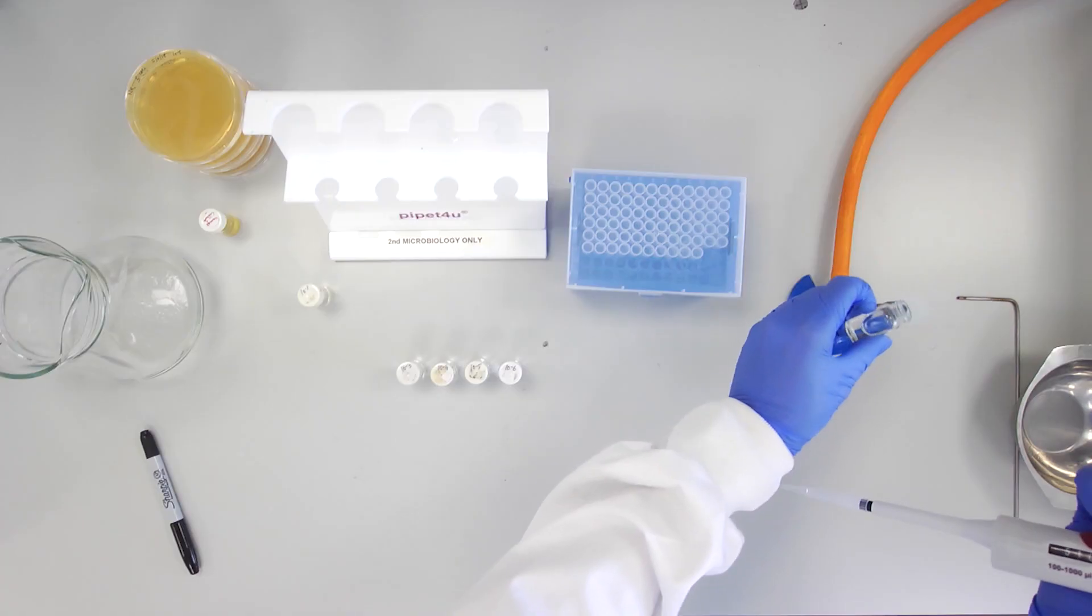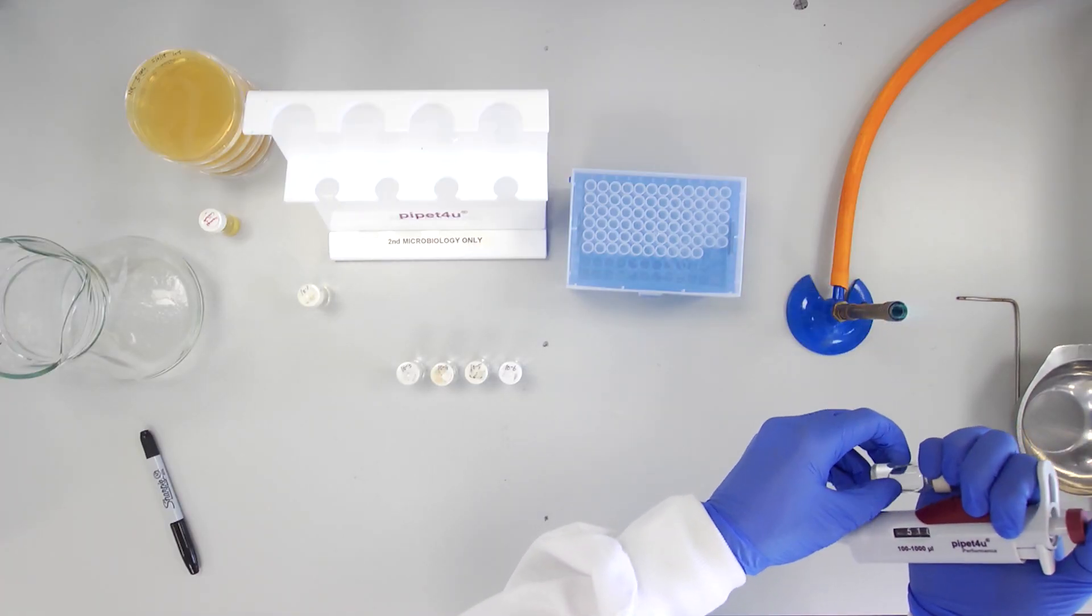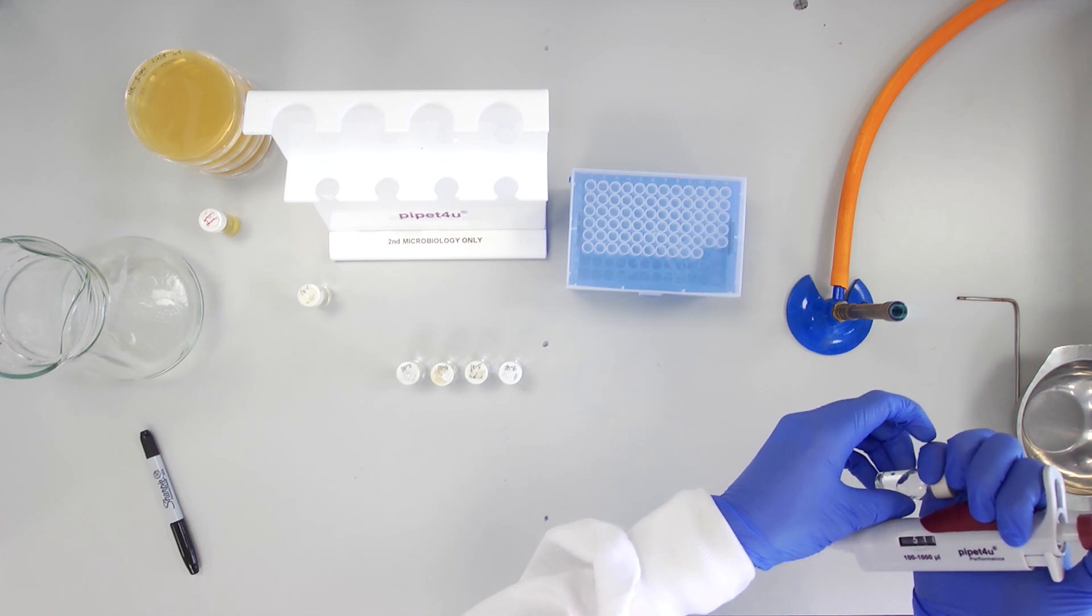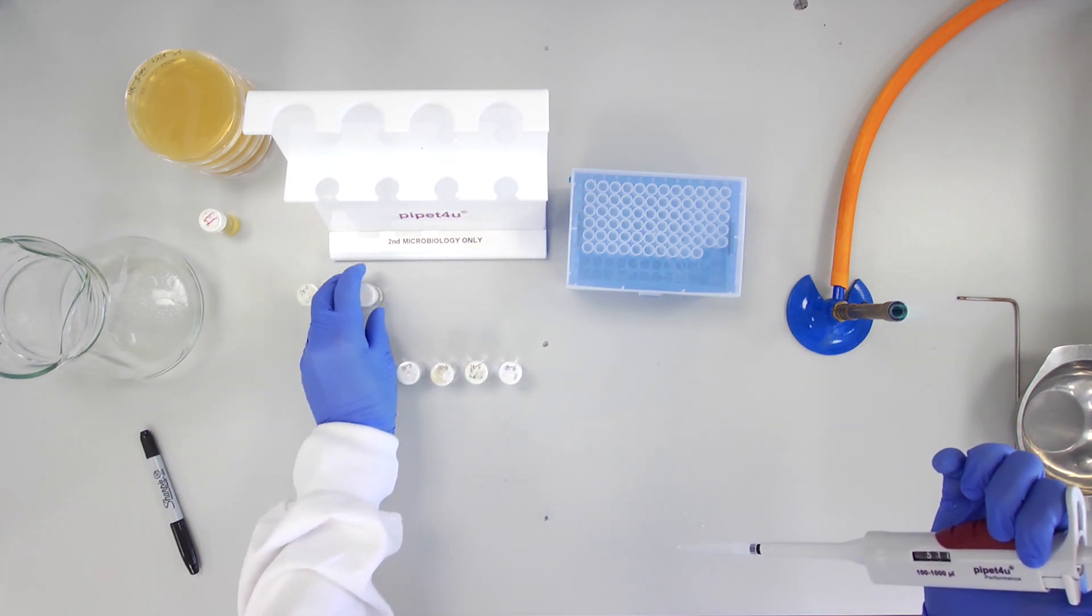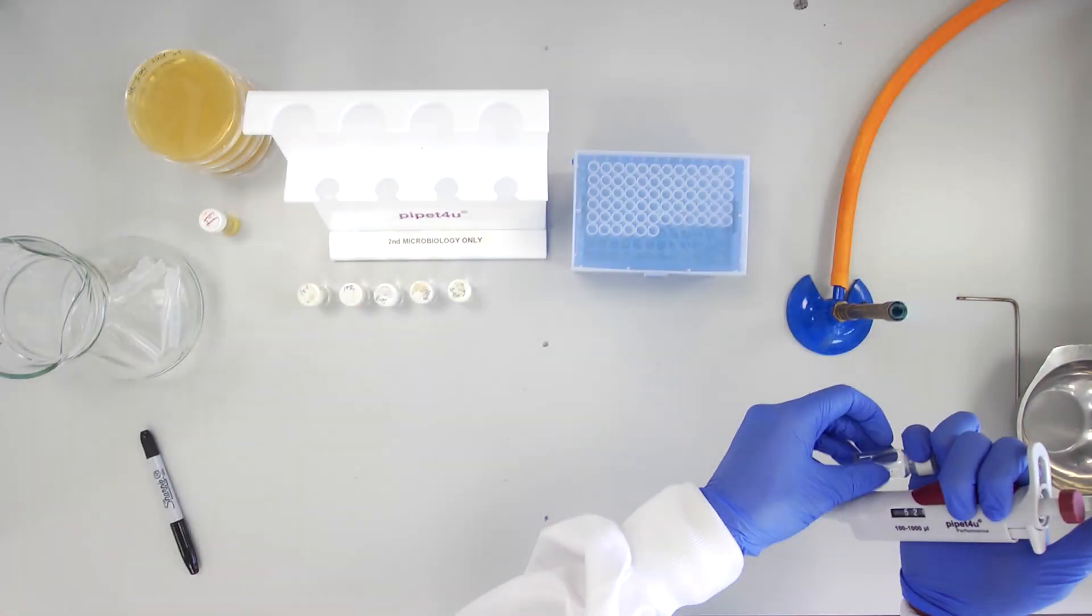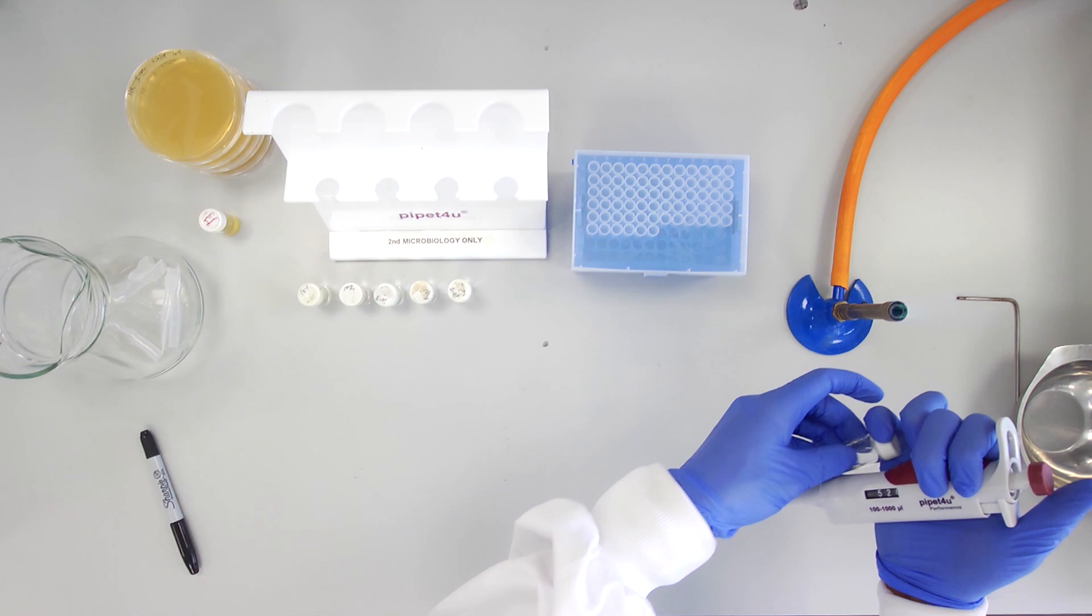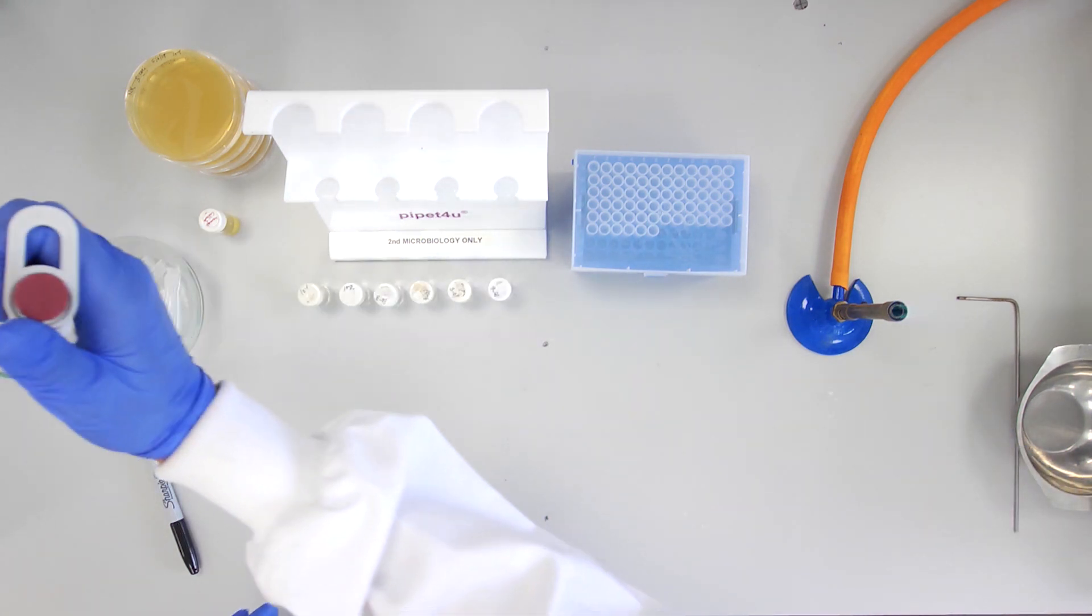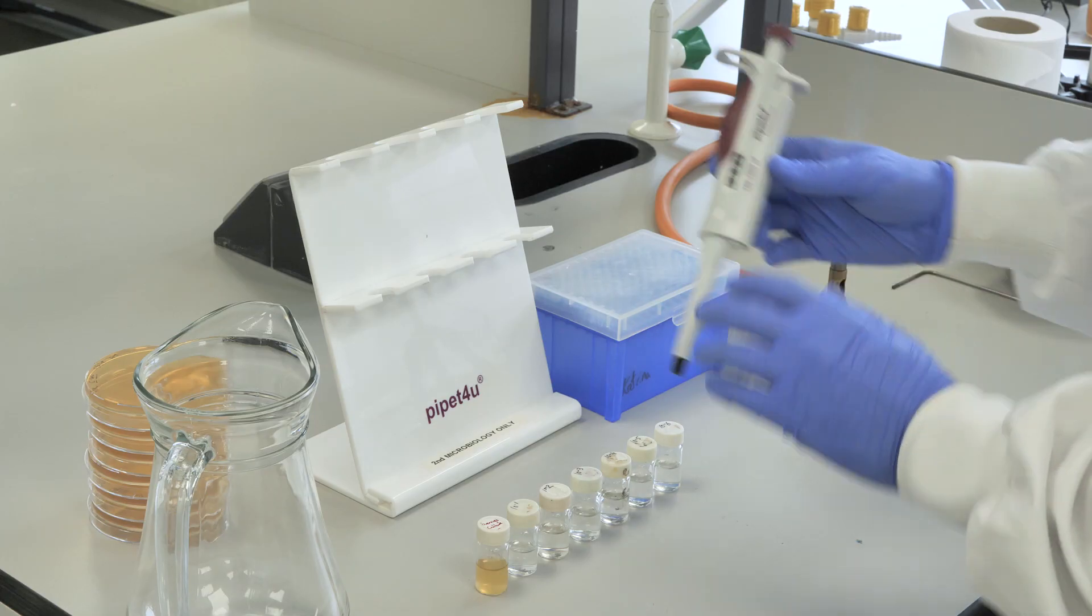Repeat these dilution steps, taking care with aseptic technique at every transfer until you have made a 10 to the minus 6 dilution. These samples are now ready for plating on TSA agar.